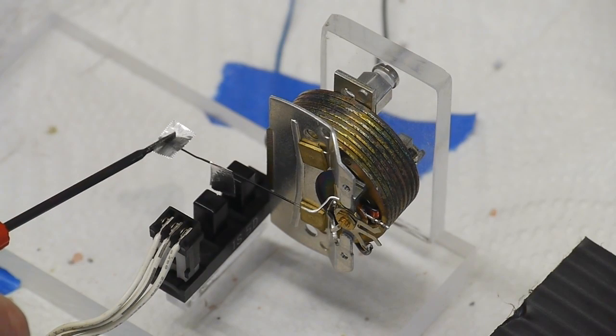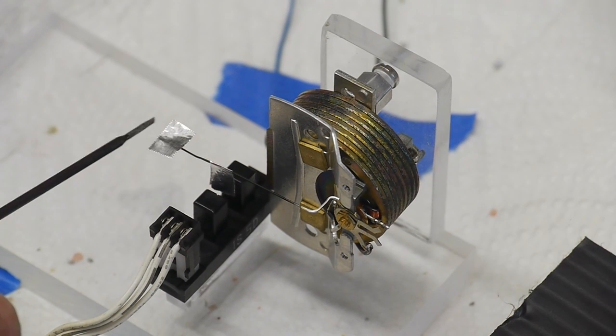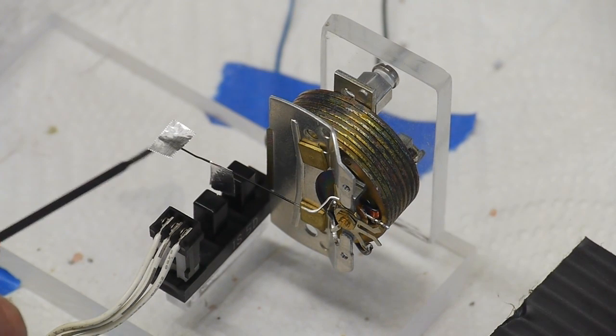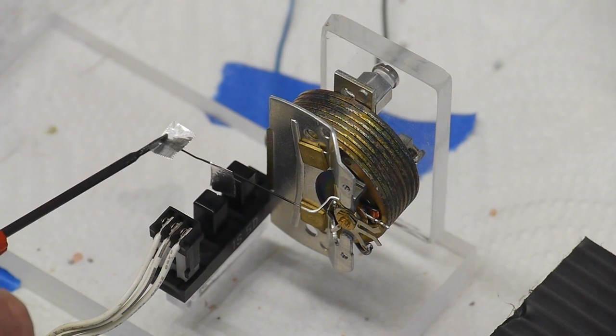So if you see, I can perturb it here and it will actually servo itself back. And it's not temperature stable, so I've just recently adjusted the pot that controls how snappy this thing is. But it's currently in a pretty good spot where it's not prone to oscillation and it will servo itself back.